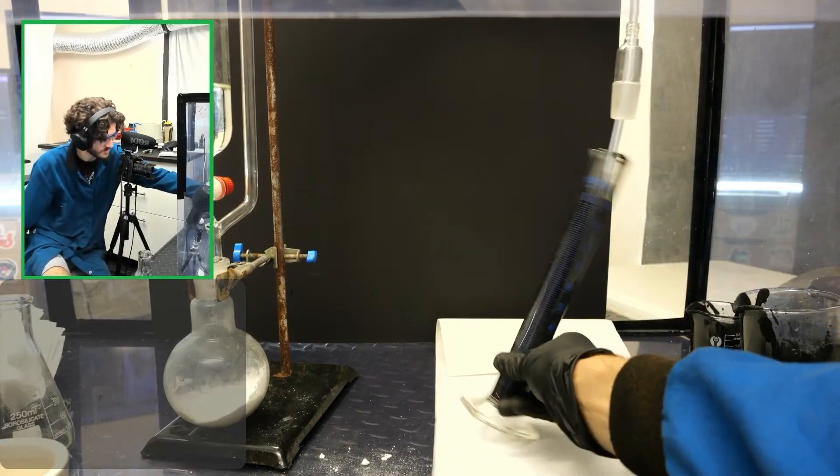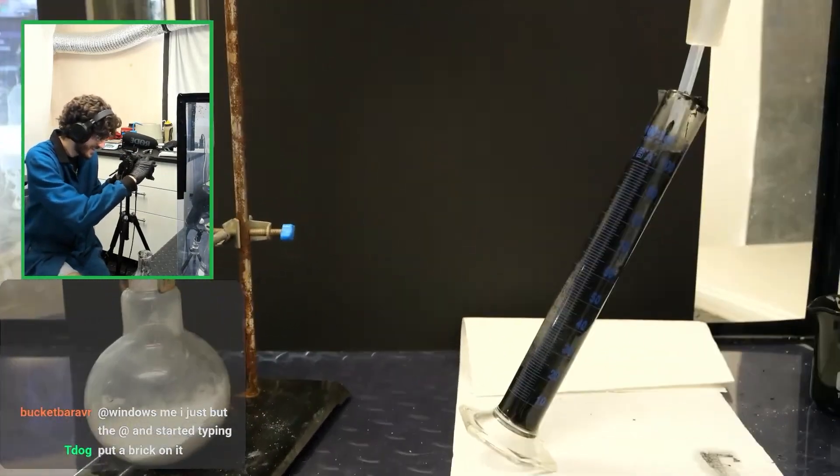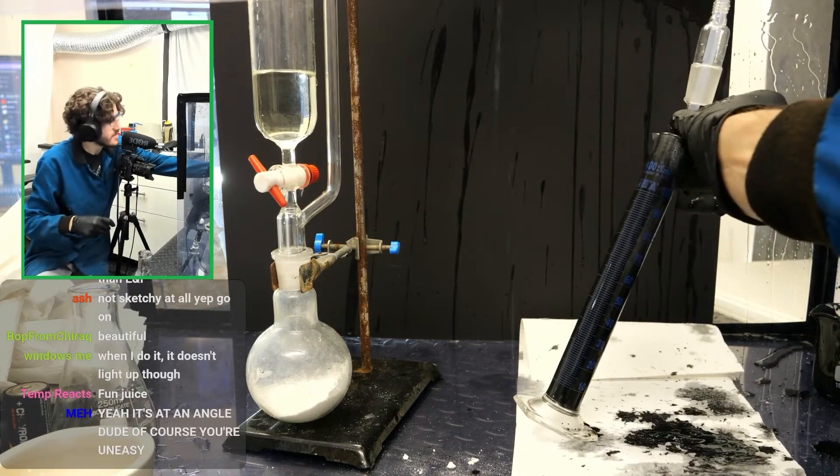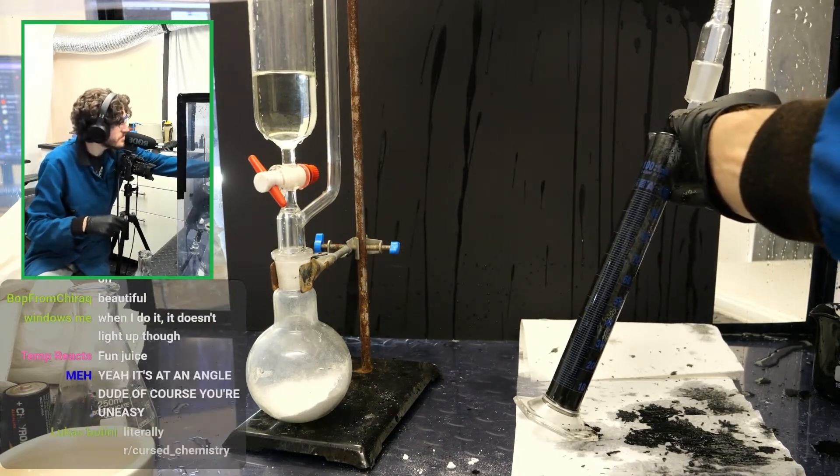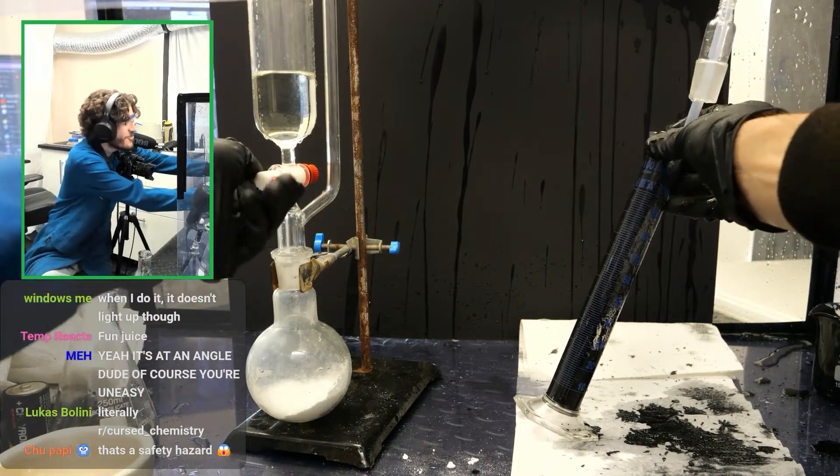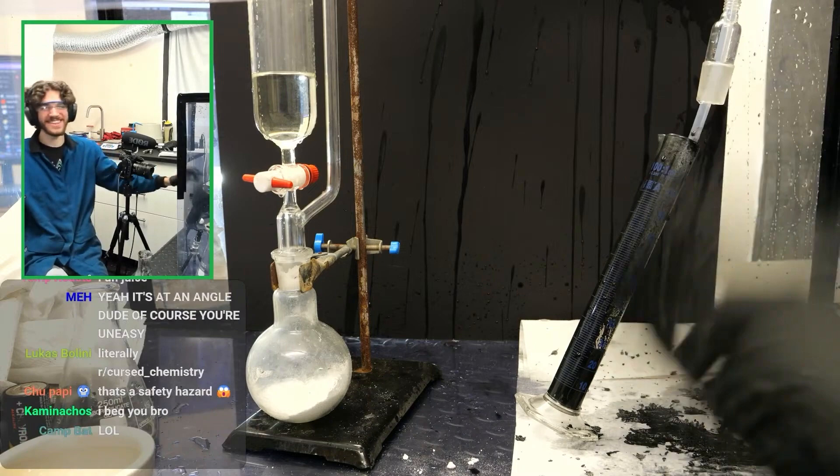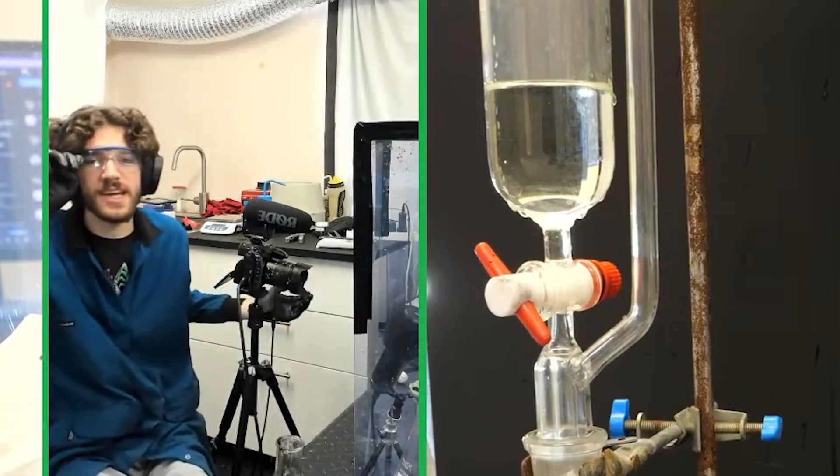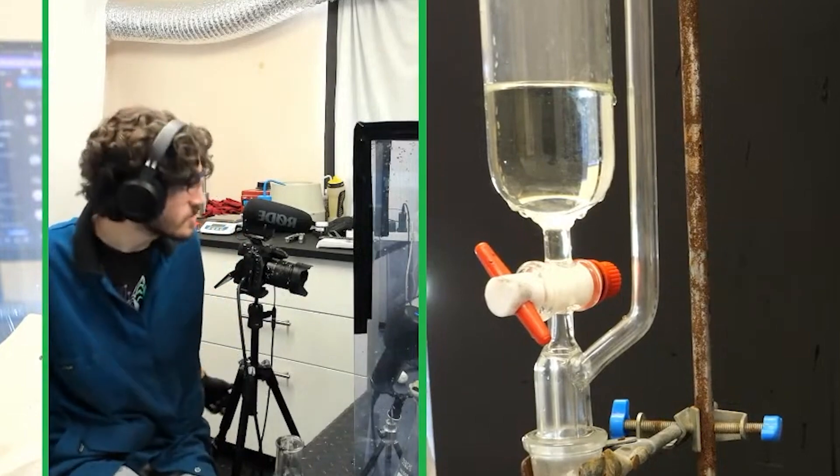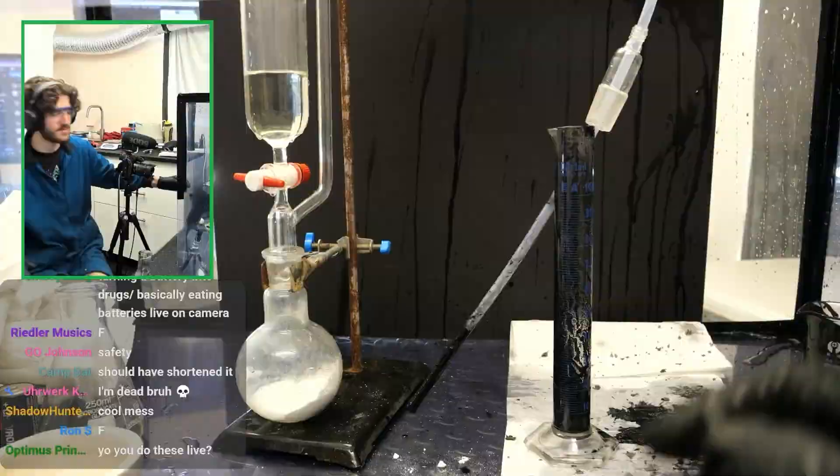Maybe I should purposely put on an angle just to make people uncomfortable. Yeah, that's right. Let's go. Is there a leak? It's producing gas, we're not going through. Holy shit. Oh, it was stuck with the manganate. I just lost like half of my product. It slashed everything. See, I don't know how. People were saying like, when's it going to explode? I'm like, it's not going to explode. It's not even possible. Yet it still happens. It'll be fine. We'll have a low yield.